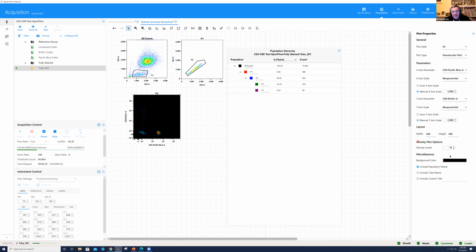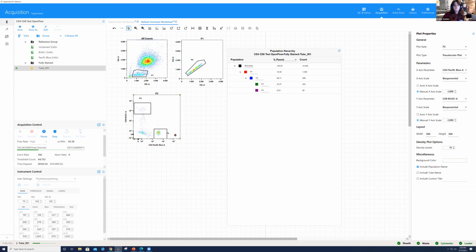Yes. So there's another question: is live unmixing just as easy if you've got more colors, or does it get harder the more colors you have? Is it slower? Any issues with the software or the hardware coping with that? No, I've had no experience with it going slower. When you have a lot more fluorochromes, not detectors, because the detectors remain the same no matter what, what can wind up happening is that initial live unmixing, when you click on it, might take a little bit longer, but nothing too drastic. It doesn't take a long period of time at all.